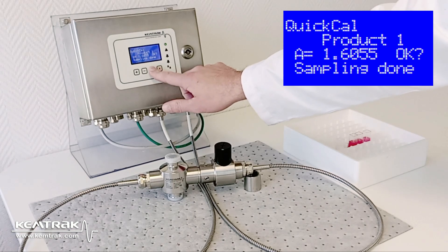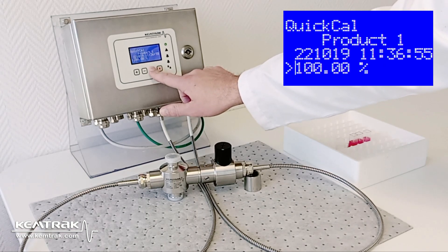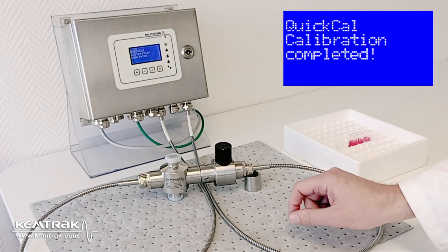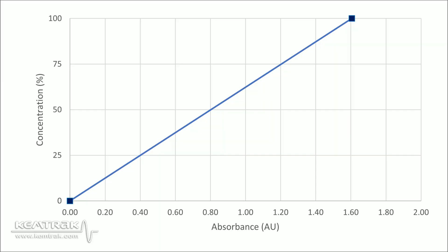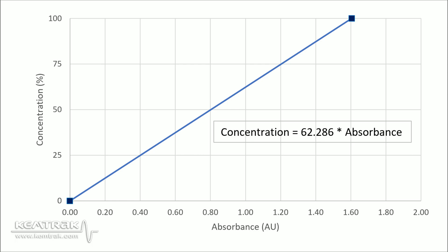I then confirm the absorbance by pressing check, enter the concentration of the analyzed sample to 100, and press check to confirm. This will automatically record the absorbance of the calibration sample and calculate a constant, which is the slope of the calibration curve, making it possible to relate concentration to absorption.